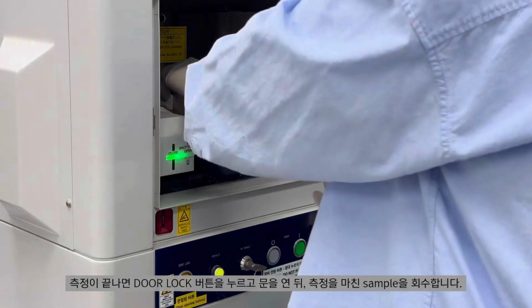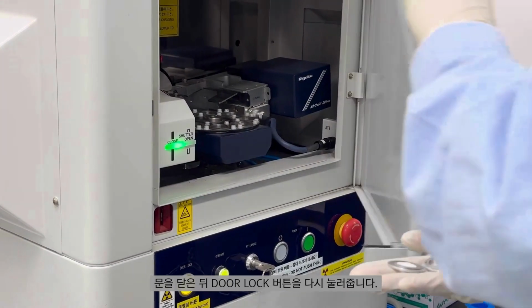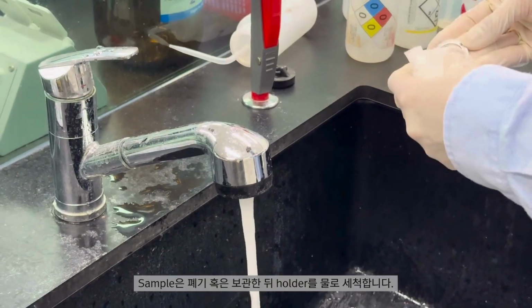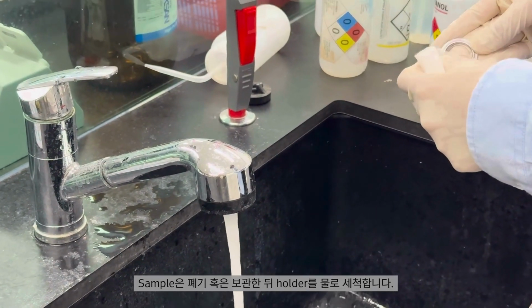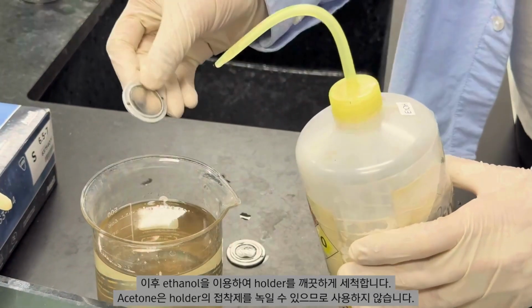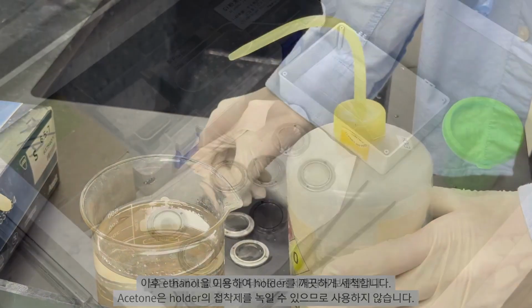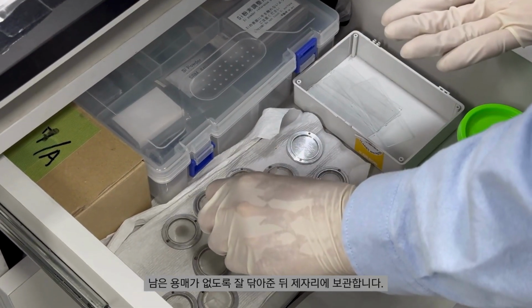After the measurement, press the door lock button, open the door, and retrieve the sample. Then, close the door and press door lock again. Dispose of or store the sample as needed, and rinse the holder with water. Then, clean the holder thoroughly using ethanol. Do not use acetone, as it may dissolve the adhesive on the holder. After ensuring that no solvent remains, wipe it clean and return it to its designated place.